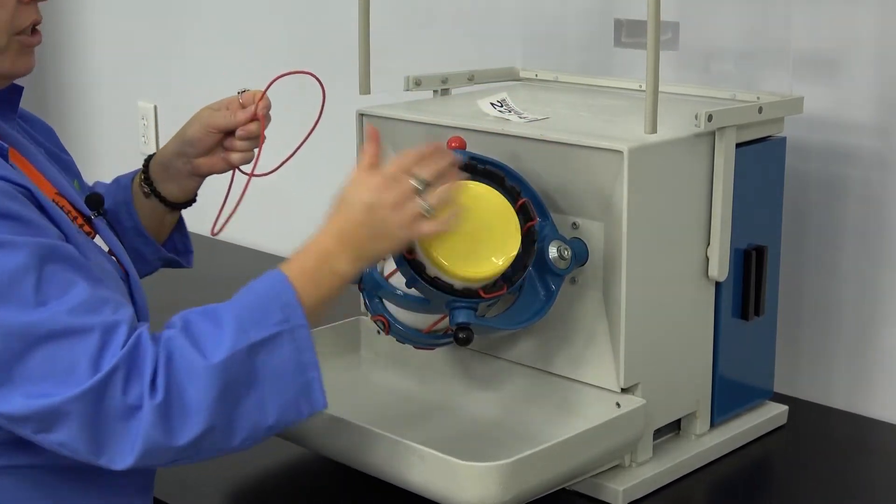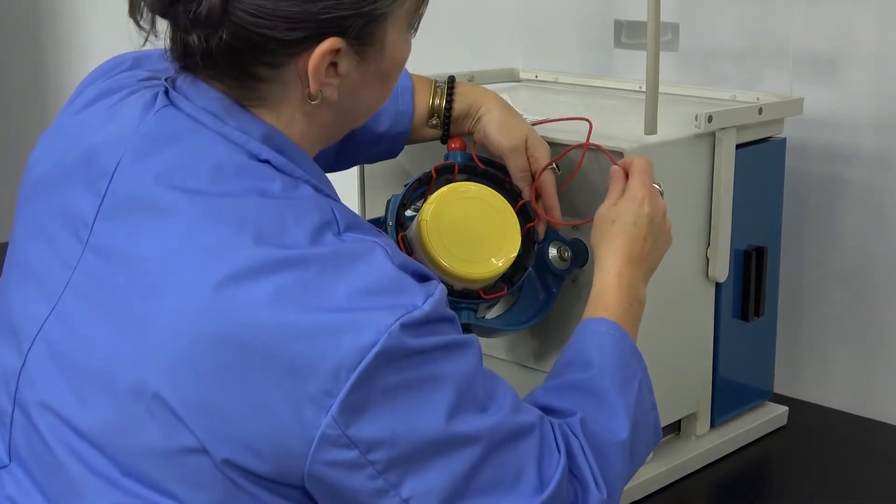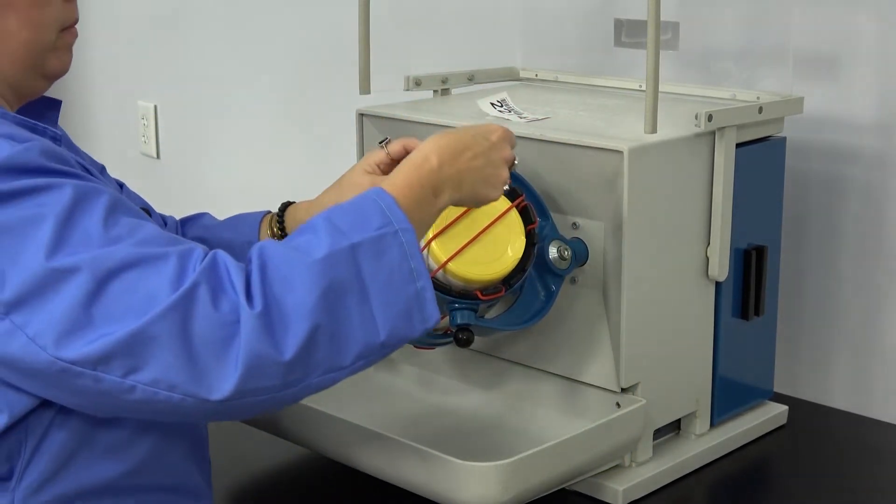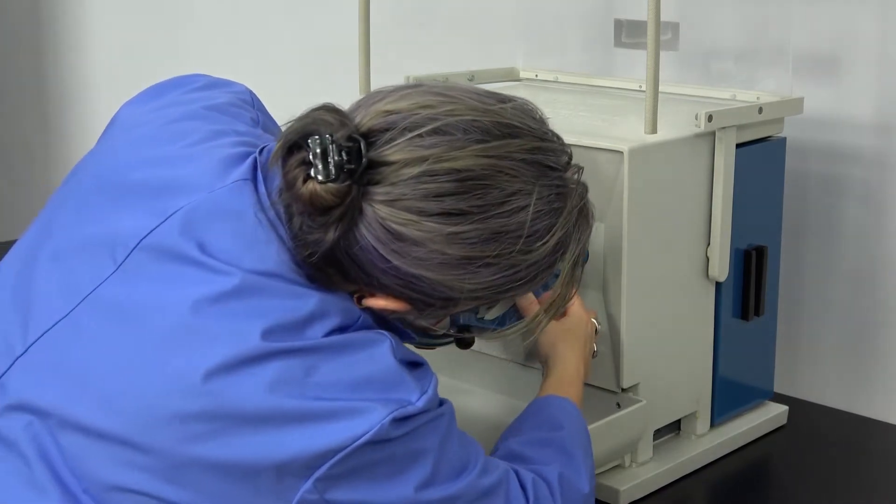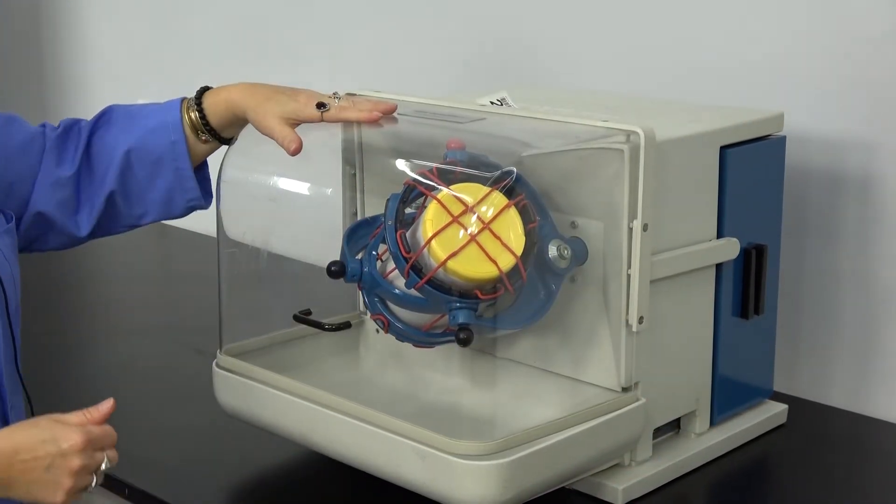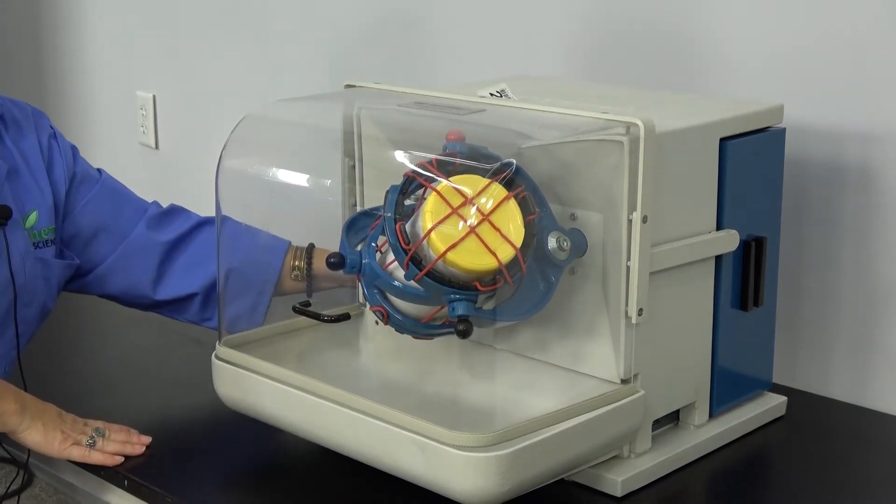Load your canister. Close the safety shield and turn it on.